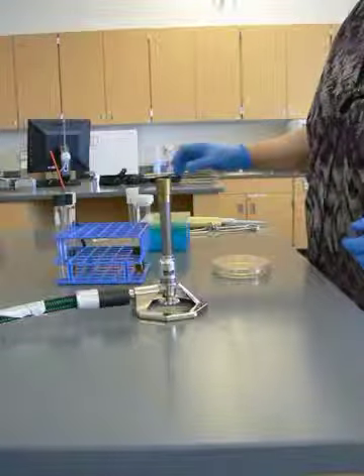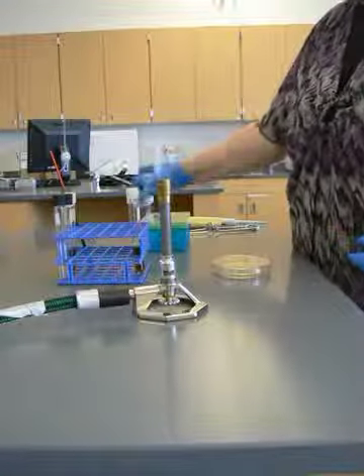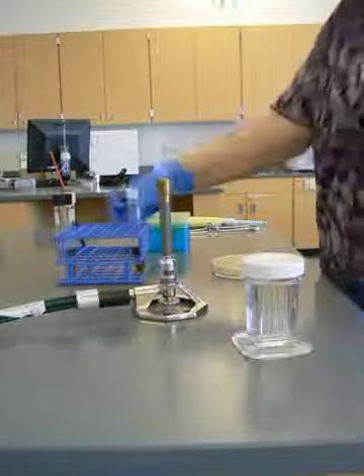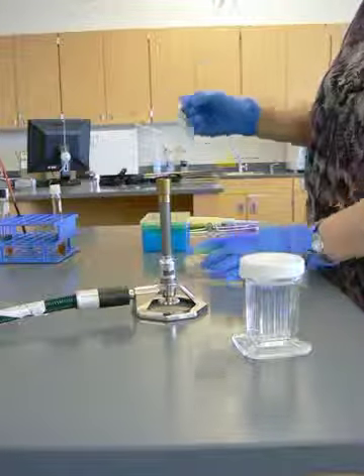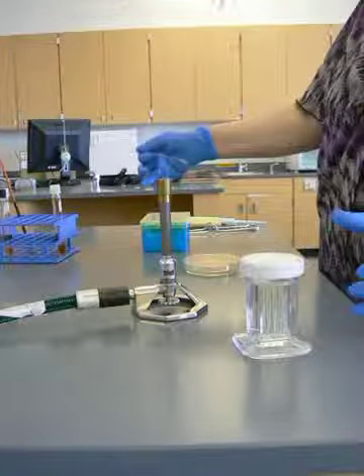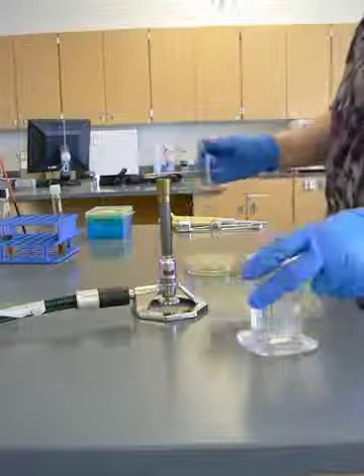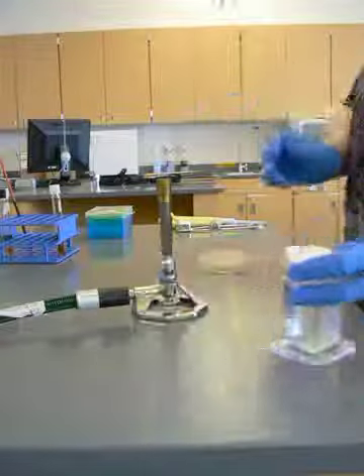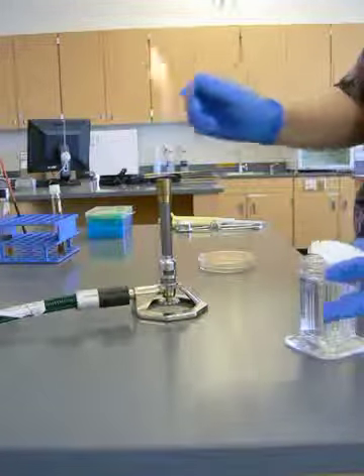Now, I'm going to sterilize my hockey stick for spreading out my inoculum. I'm getting everything that's potentially flammable out of the way. I'm going to sterilize my glass hockey stick.